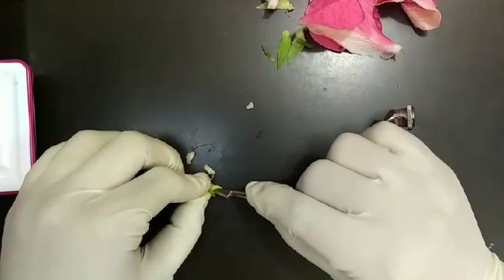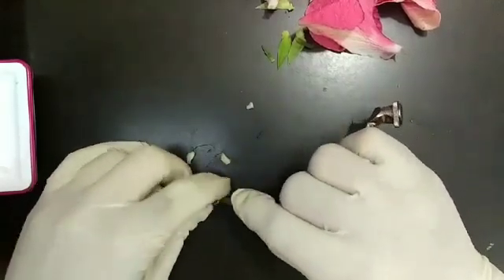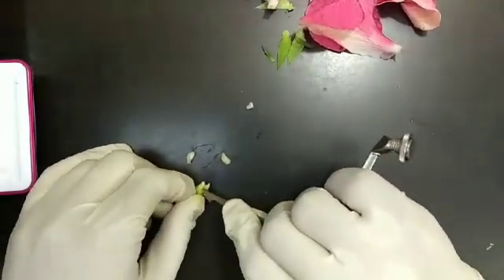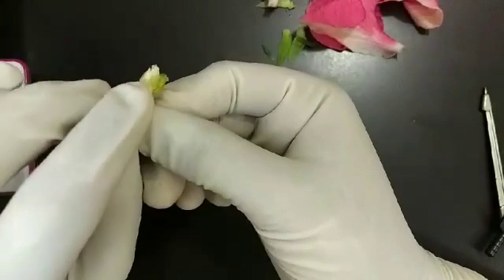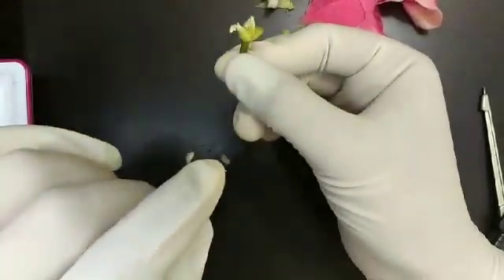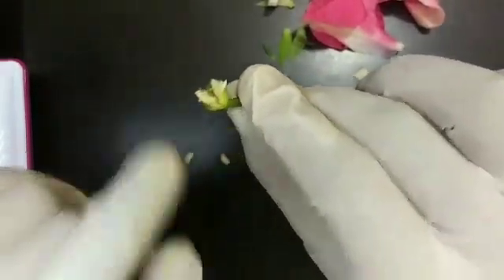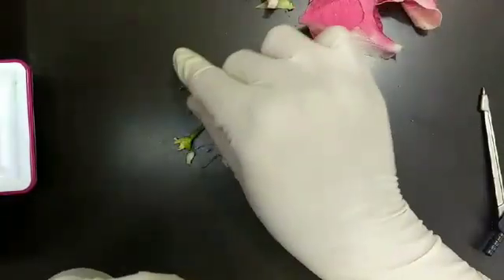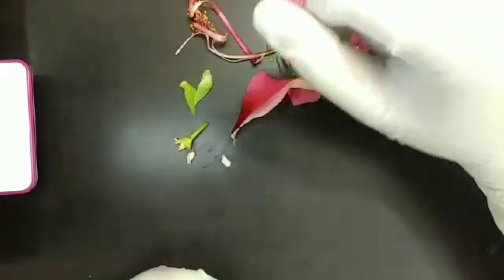I can see numerous ovules now. These are the ovules. So this was the ovary and these are the ovules. These were the sepals, the petals, the style, and pollen. With this we have completed the dissection of a hibiscus flower. Hope you liked my experiment — thank you so much.